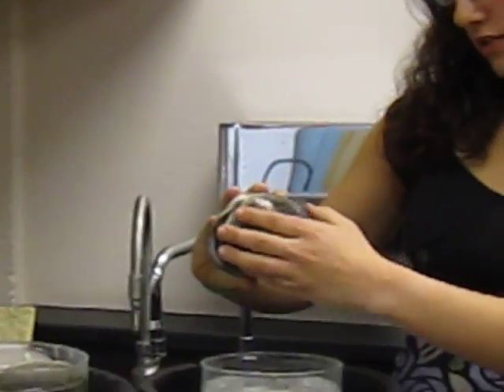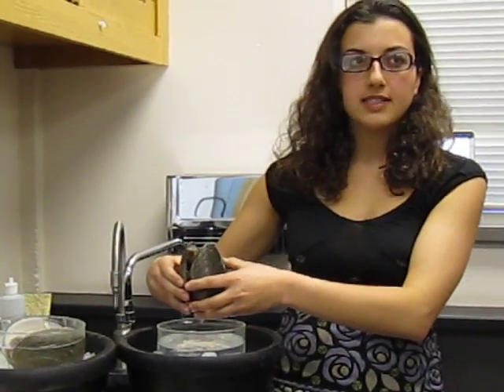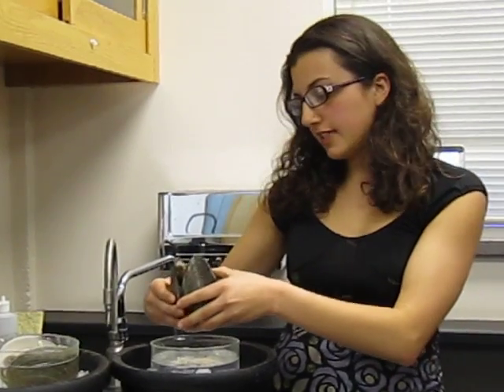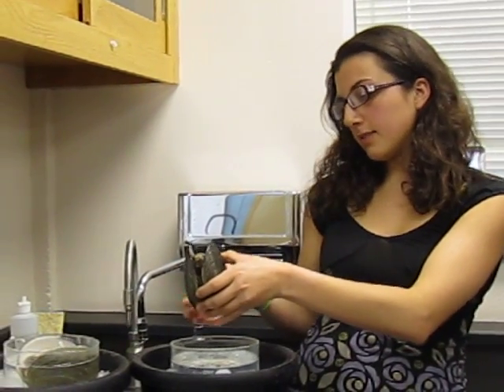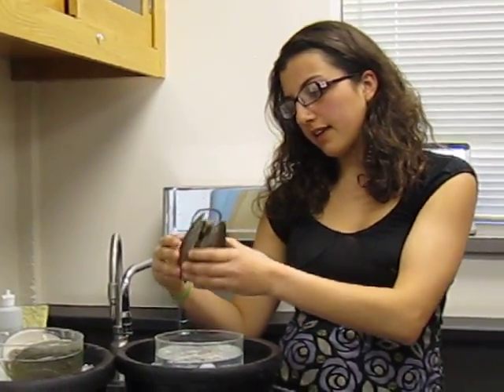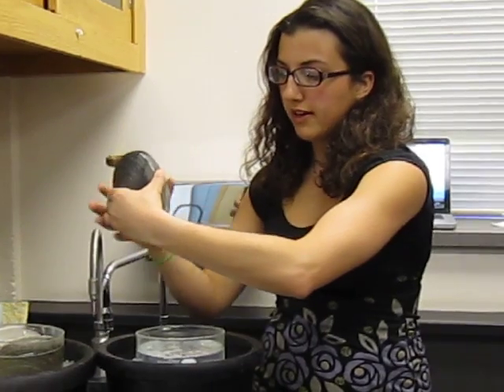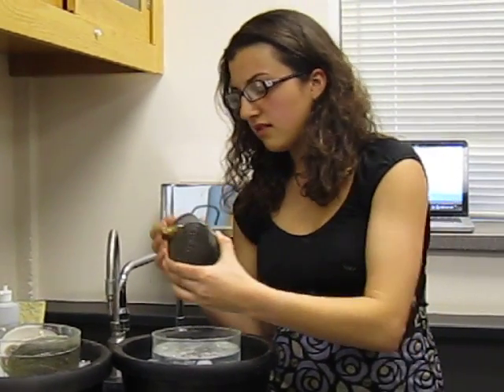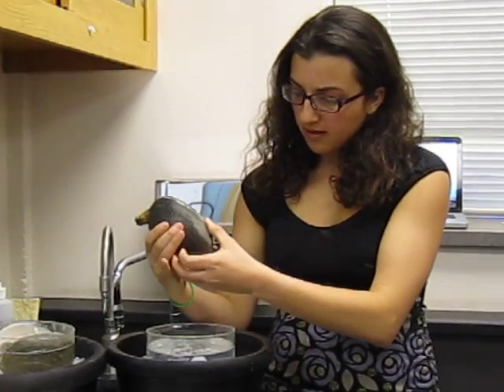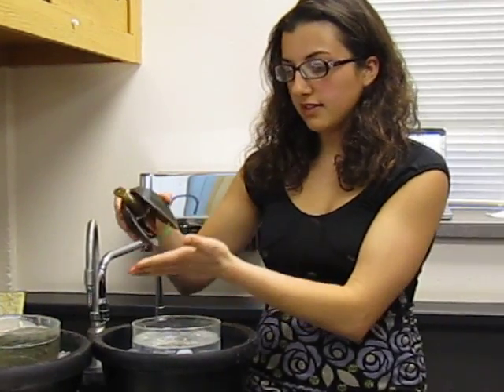Alright, and so next let's go through the directionality of the clam. Basically the way I think of it is, anytime I see a clam, like the one in the tank, it's always like this, because it has its siphons up so it can take in water, let out water, and the foot goes down. So even though it's a little bit counterintuitive, this is the anterior end. It's the end where normally you'll see the foot out. This one's closing up a little bit. But yeah, this is the anterior end, this is the posterior end, this is dorsal, and this is ventral. Okay?